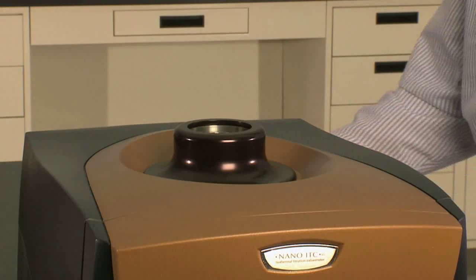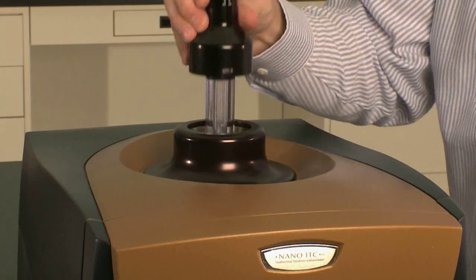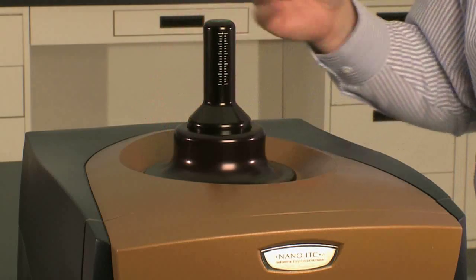Now you can return the burette handle and let it equilibrate for a few minutes while you load the syringe for the experiment.